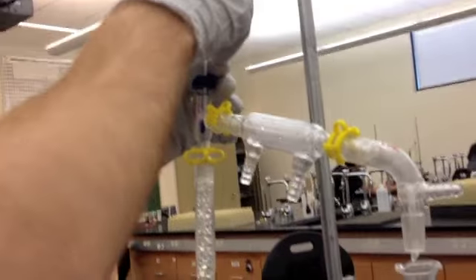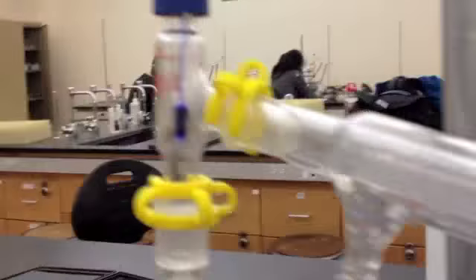Again, make sure your thermometer is not dropped very low. As you adjust your apparatus, your thermometer might drop a little bit, so make sure it's adjusted correctly. And make sure your apparatus is as straight as possible.